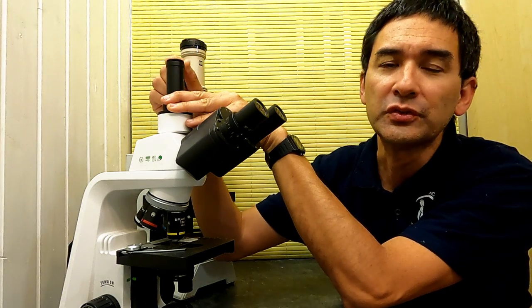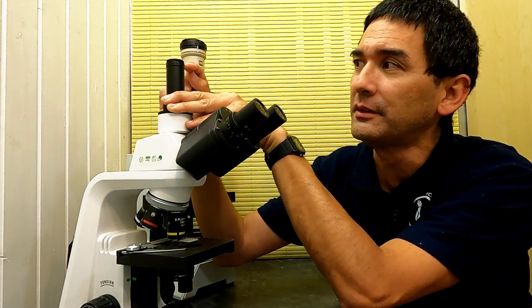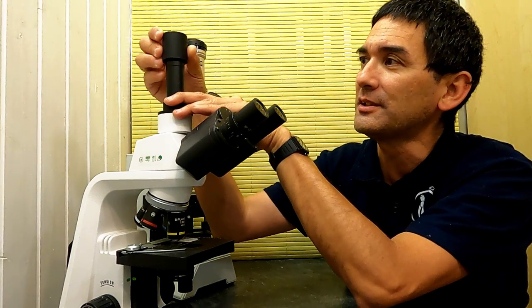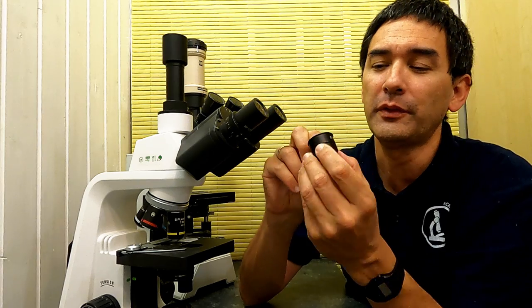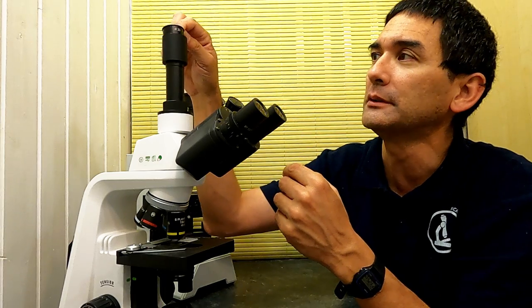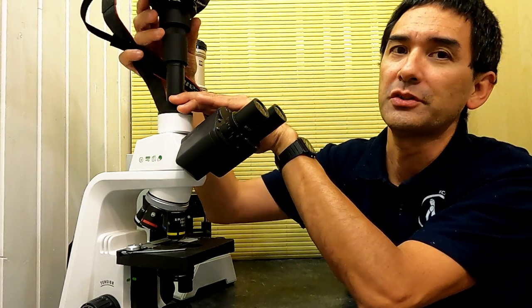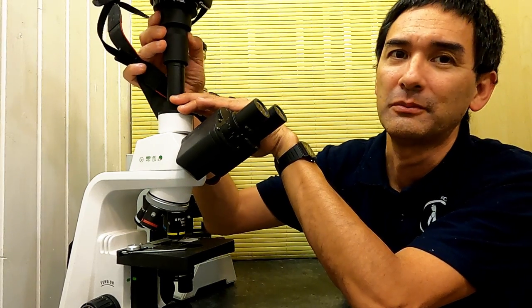And a C-mount allows you to directly connect a microscope camera without optics. So if you put a microscope camera here, then the image is going to be directly projected on the sensor. And indeed, I was a little bit surprised. It does fit. Look at this. Okay, but the question is now what? I did figure out that it is possible to take one of those eyepiece adapters for a stereo microscope and put it in here at the top. And then you are able to insert the camera in here. It goes halfway in, so you're still able to access the little thing here for closing the diaphragm.